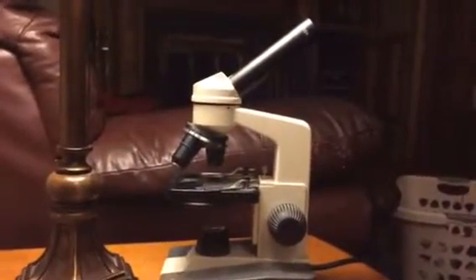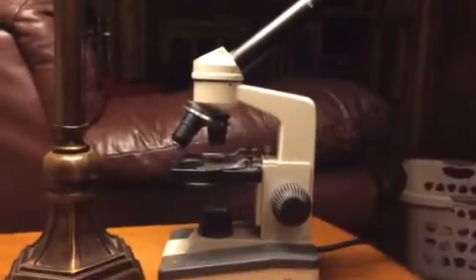This video is on the parts of a microscope. This will be an example of a really basic microscope. On top is where you have the body tube.